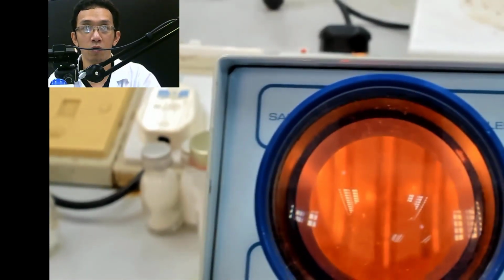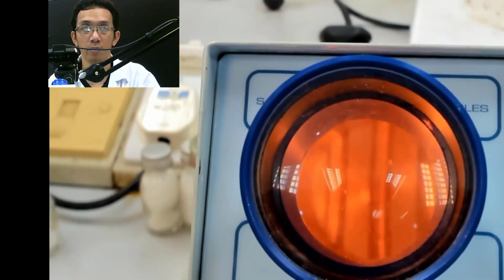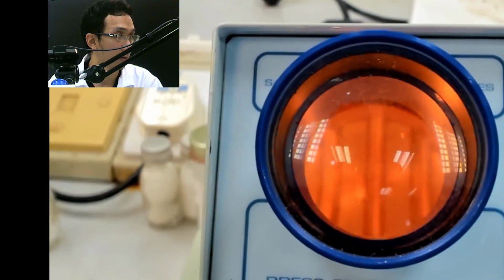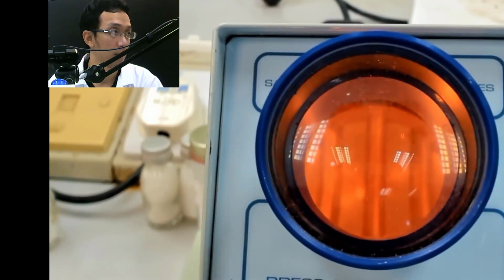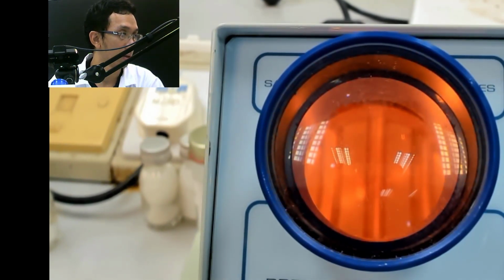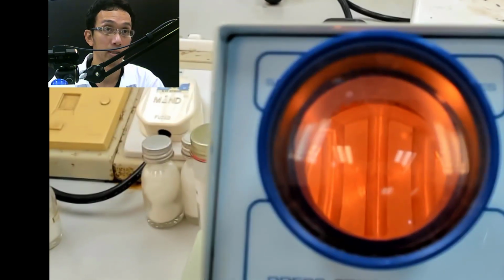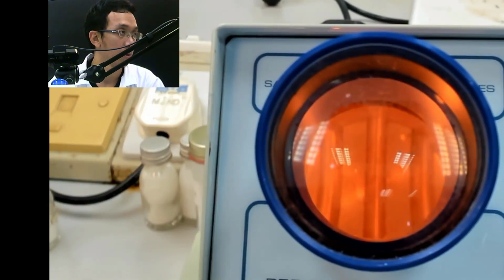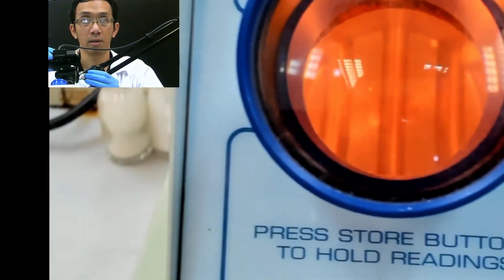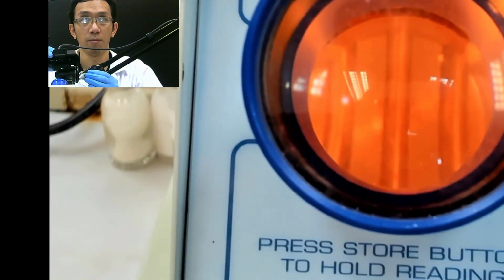Because this you will do yourself. I just said this will take some time. If you look there, okay, I wanted to adjust the zoom. Okay, so that is the thing. That is your sample, it will be put inside that.